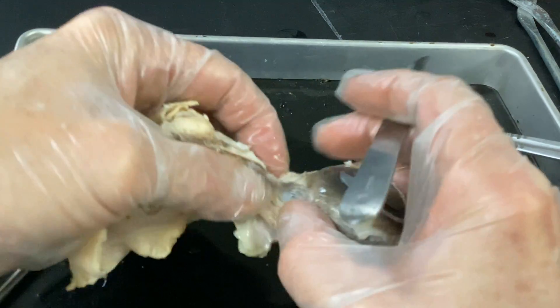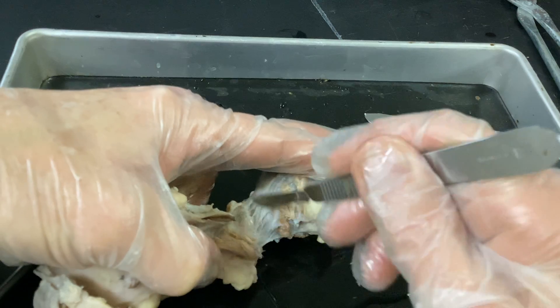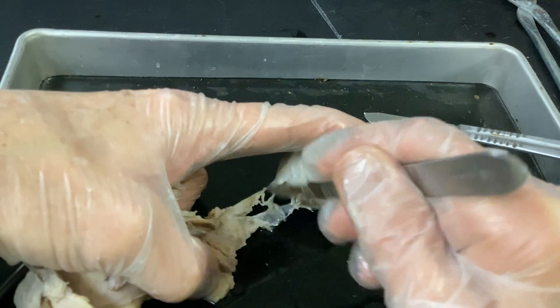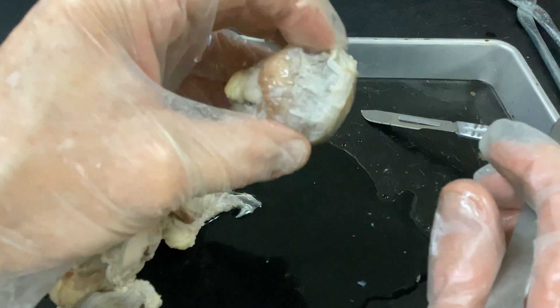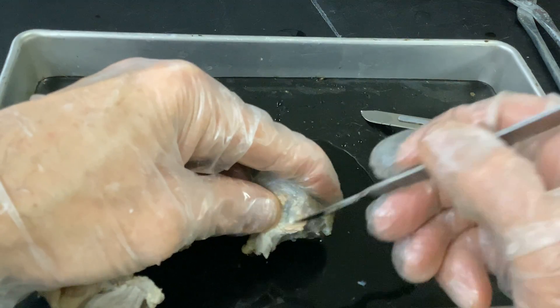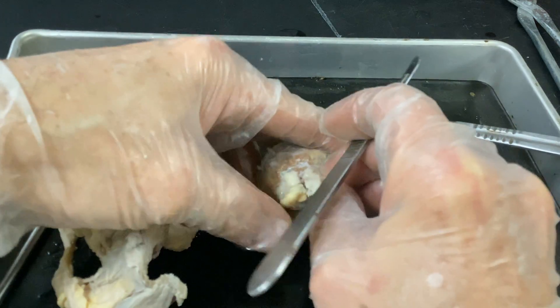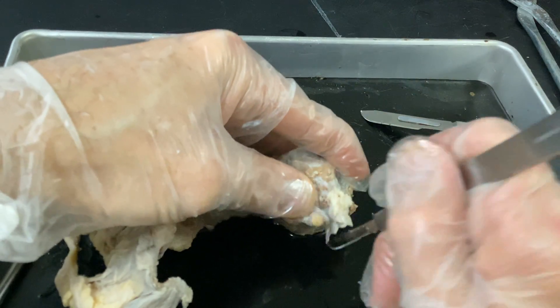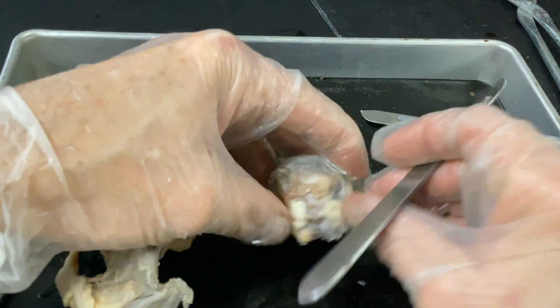Remember I said in class, please do not hack when I do a sagittal cut. I'm not going to hack into it because I don't want that vitreous humor shooting out. It's going to be very gelatinous — the viscosity is very high. But now that looks a lot more like what you'd consider an eyeball. That is cranial nerve 2 — that's the optic nerve, coming right off the retina.